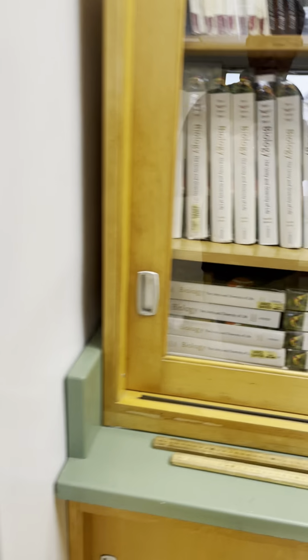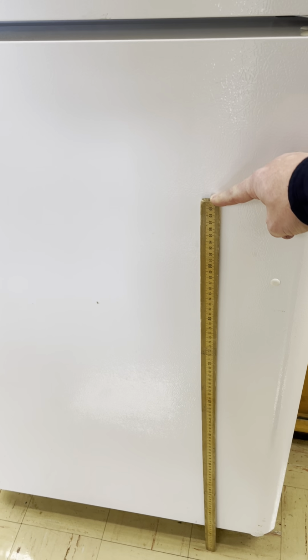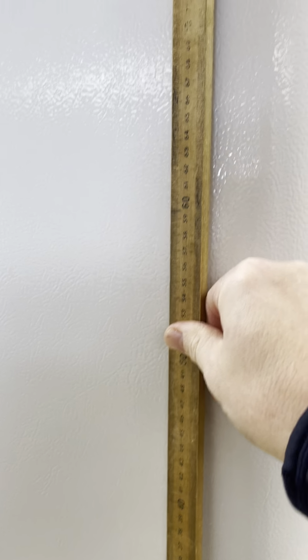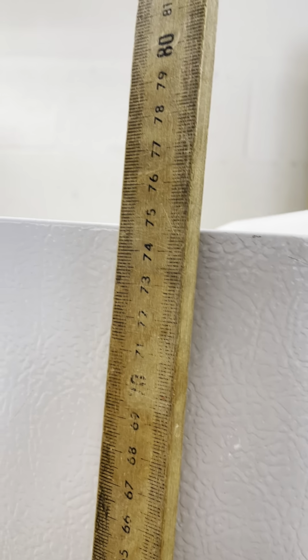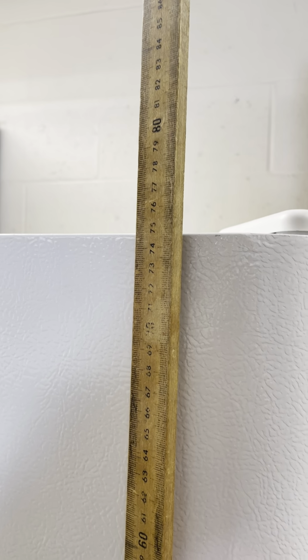Measuring the height of the refrigerator, we have meter sticks. Use the centimeter side. Don't use the inches side. So here's centimeters. If we measure the height of one, there's 1 meter off the ground, and then we need another one. Again, hard to do one-handed, but I'm here for you. If I put another meter stick on top, I get up to 175 centimeters, or 1.75 meters. That's for length, right? And we use meters or centimeters for length.